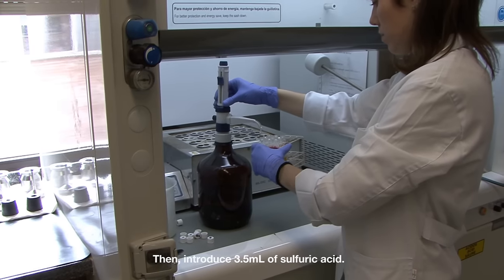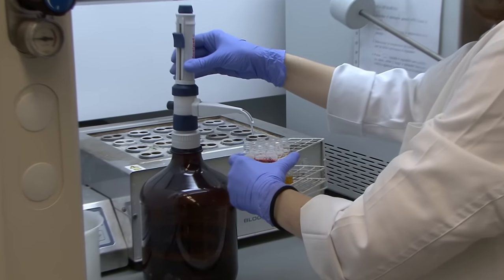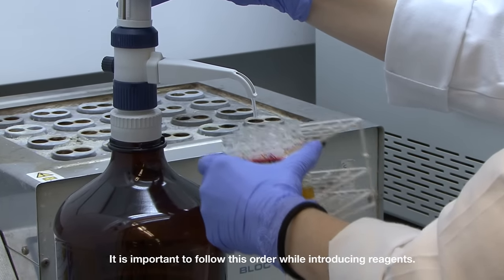Then, introduce 3.5 ml of sulfuric acid. It is important to follow this order while introducing reagents.